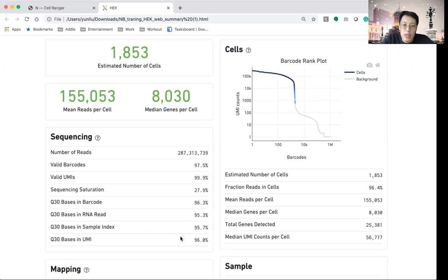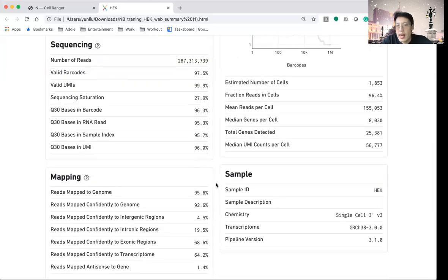All the remaining numbers give you different levels of quality control. You can see it's all over 90%. After sequence alignment, we also want to know the percentage of the reads that are mapped to the genome of the species that you are sequencing. In this case, 95% are mapped to the human genome. That is really good news. It indicates that you got a lot of very useful data for your results. The reads mapped confidently to the genome are 92%, and to the intergenic region, 4.5%.